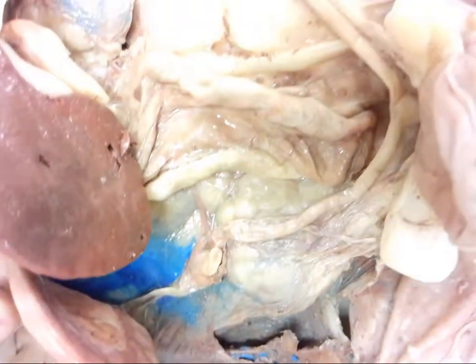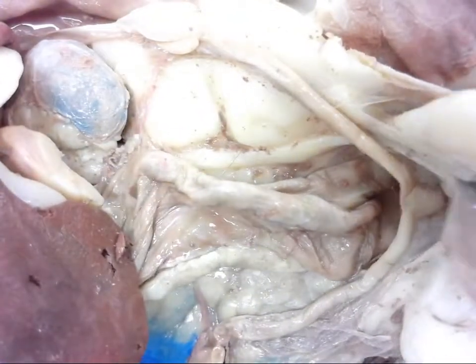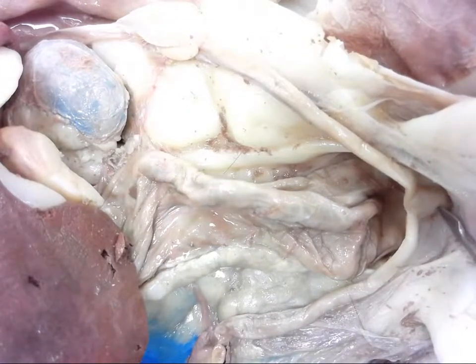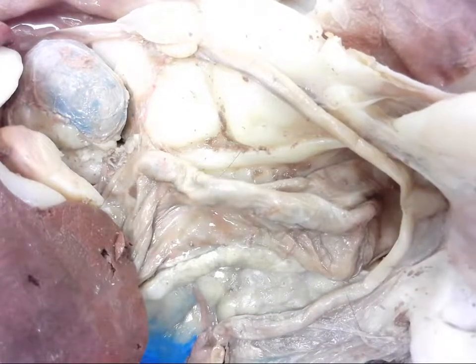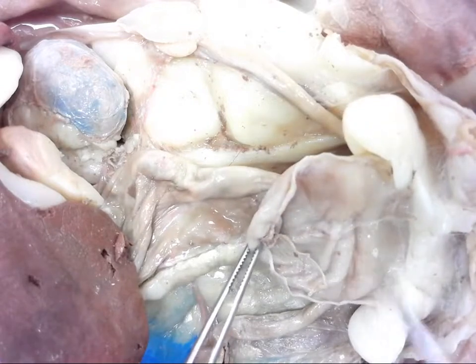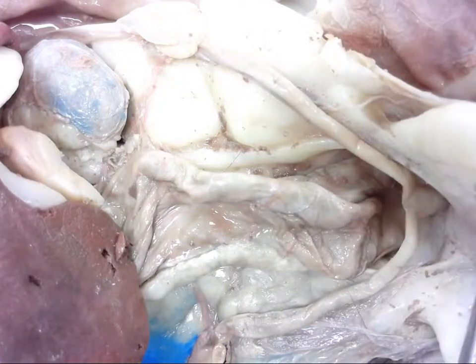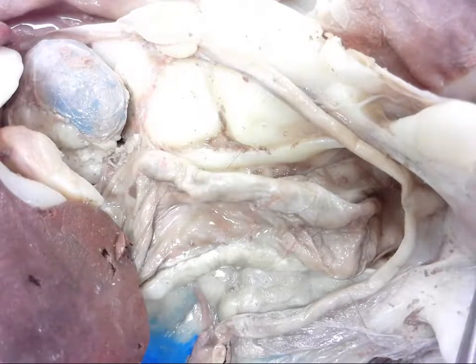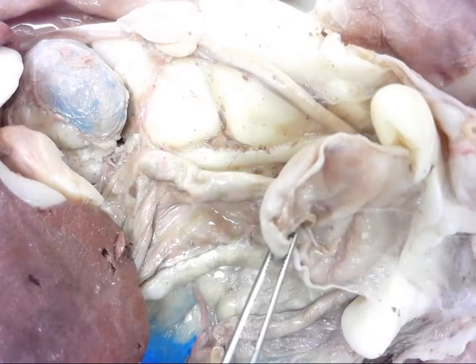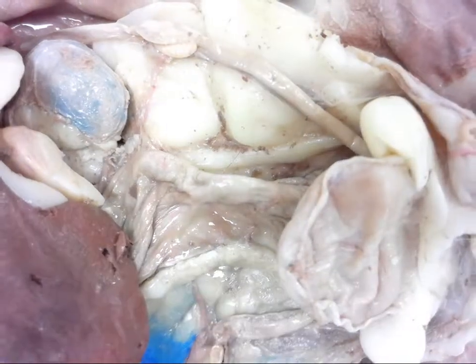So ovulation occurs, the egg goes down the fallopian tube into the uterine horn where it could be fertilized. After gestation occurs, the babies are going to pass through the uterus, which sits right behind the bladder. The bladder is here - if you lift that up you'll see the uterus. You can see the placement of the bladder and how that may cause a problem.